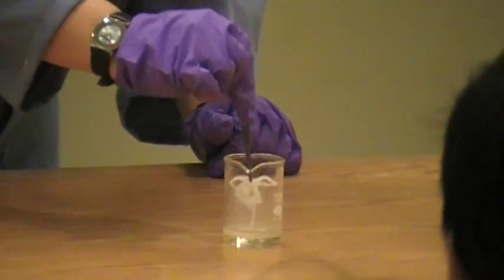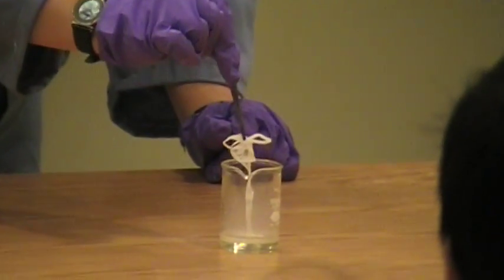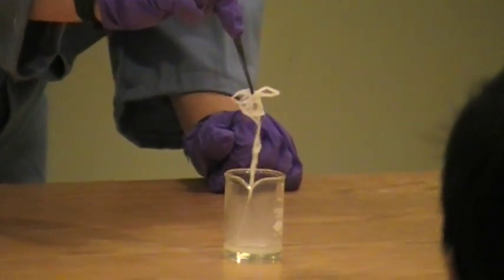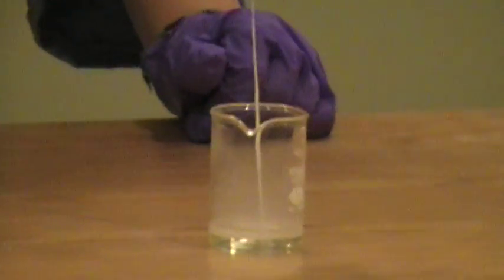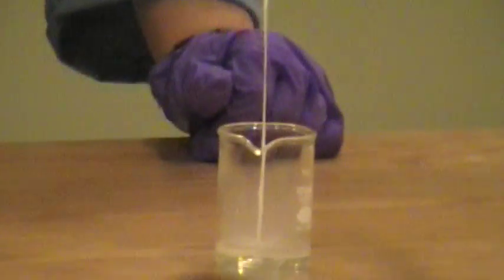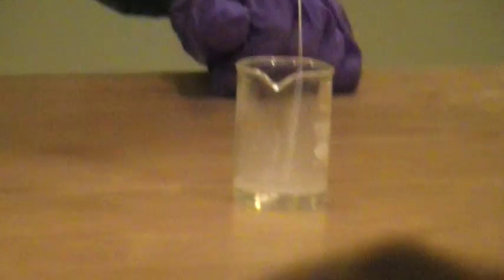But, I mean, if I was a good machine, I'd make a nice, even thread, and you could knit a nylon scarf for a mouse out of this or something. But, you know, tiny little molecules, which you can't possibly see, turn into this giant macroscopic thread of nylon. I keep breaking it.